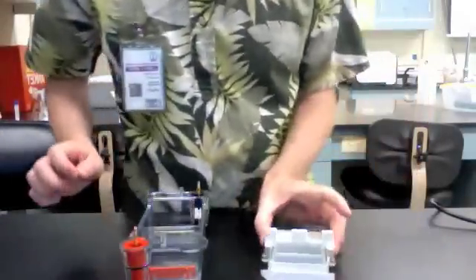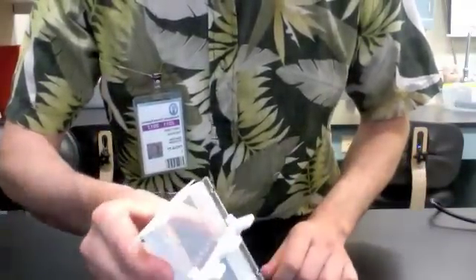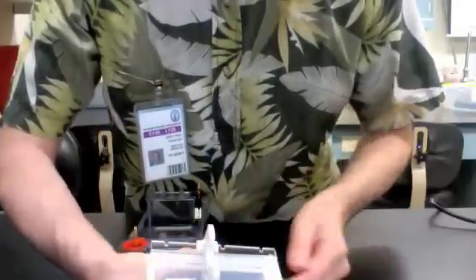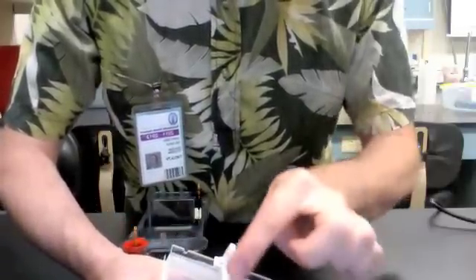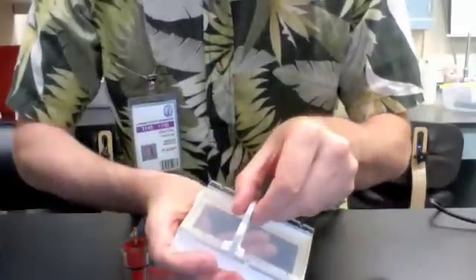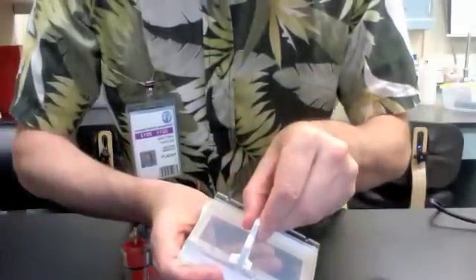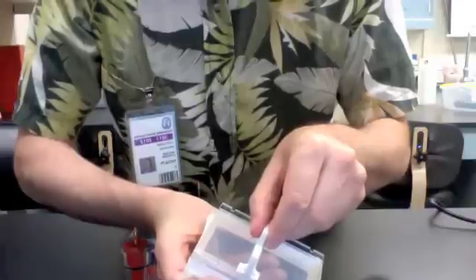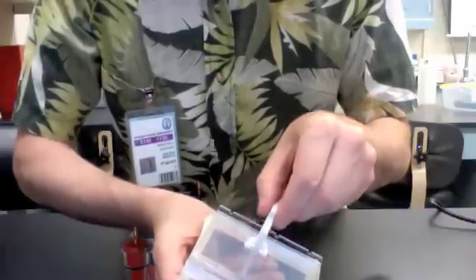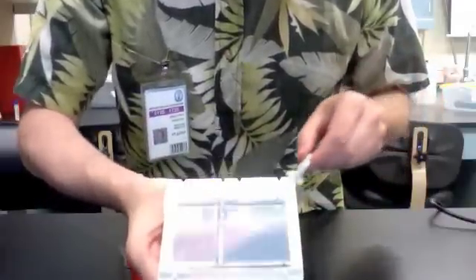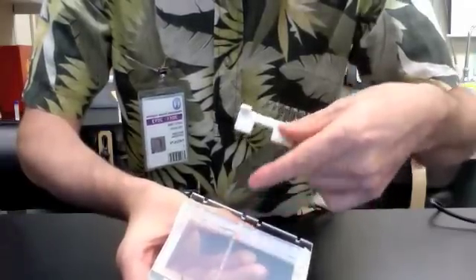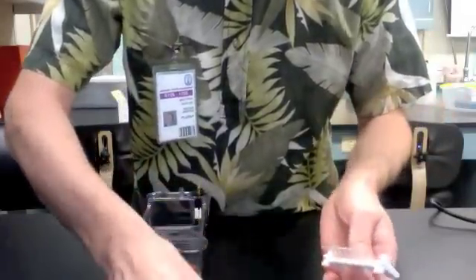When your gel has hardened, it will look like this. It's fairly translucent—I can still see through it, but you can tell it's become a little cloudy. Here's the comb. Now very gently, I'm going to remove the comb from the gel. If you yank it out, you'll tear the holes. You can see there we have the holes in the gel. These are the wells you're going to use.